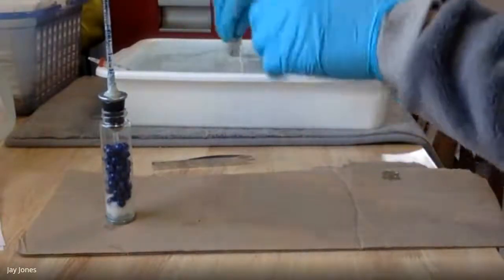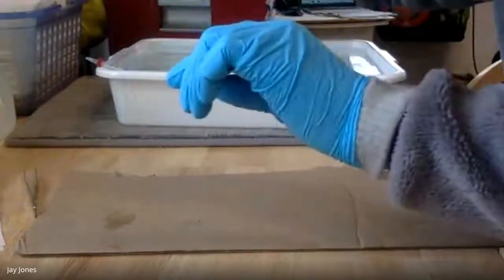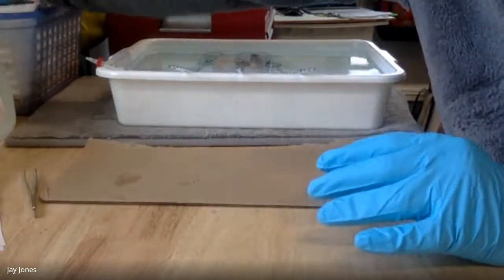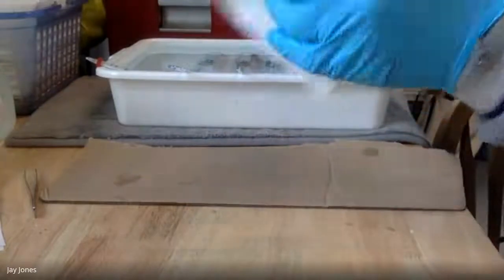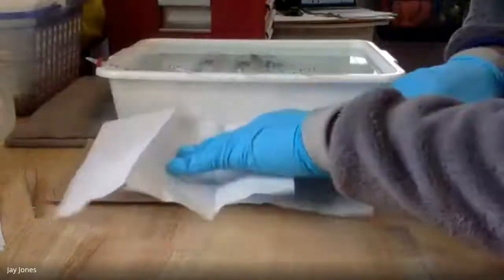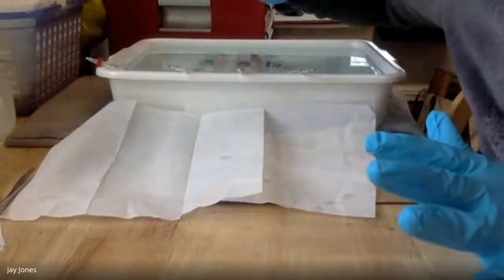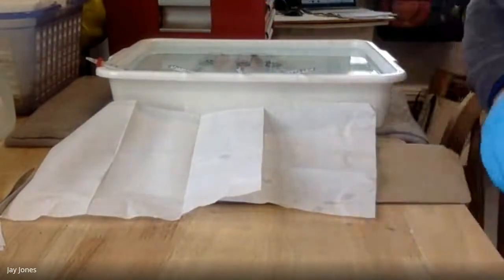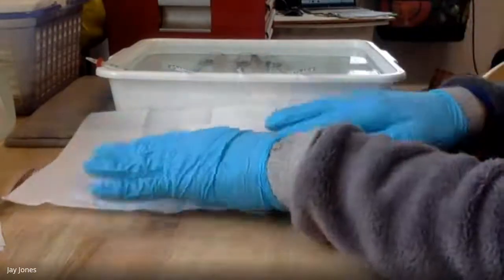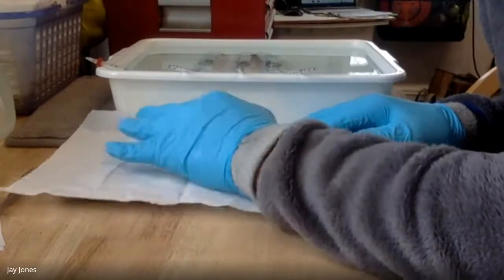The first thing I'm going to do is gently put them in this water bath so that the glass and the peas and the beads all equilibrate with temperature. I need the temperatures of these to be consistent, meaning I don't want any surprises. So I'm going to wait for 3 minutes for everything to get the same temperature. This is not time 0 yet. Shreya is going to record the times for me. This is the equilibration period, so we're not recording anything yet.